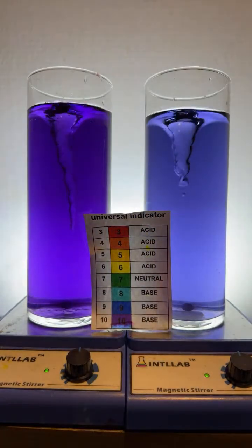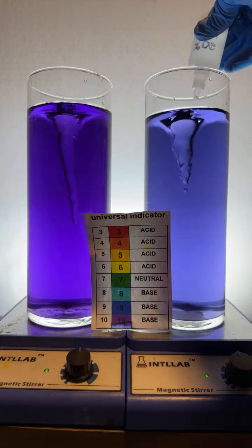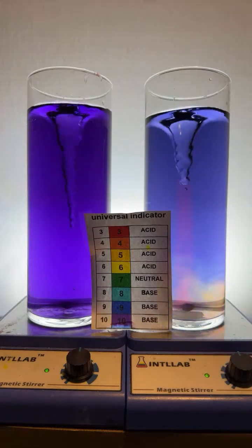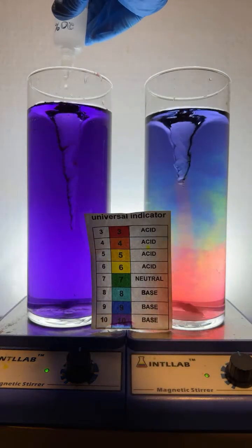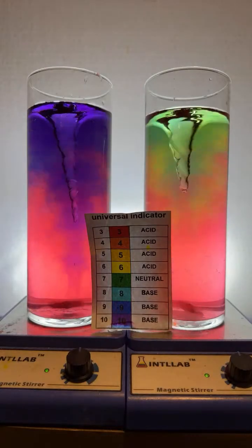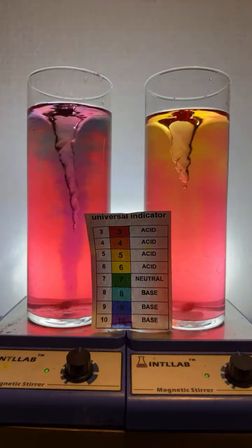Okay, let's add some acid over here on the right-hand side. You can see me adding it right up here at the top. In goes a drop. And we're going to add 2 drops over here on the left. 1, 2. You're welcome, Jess.